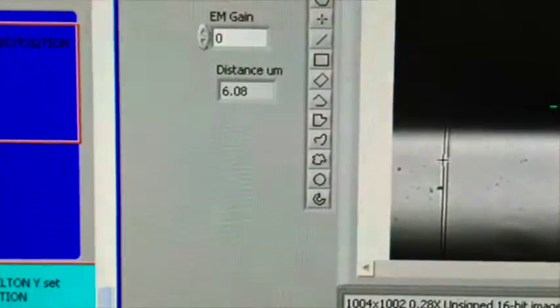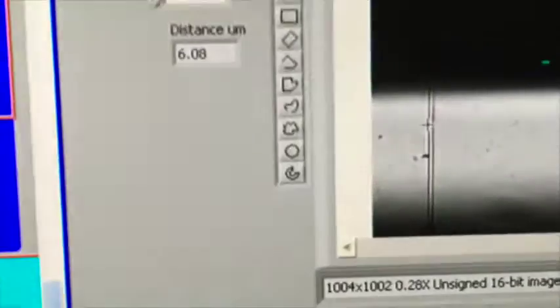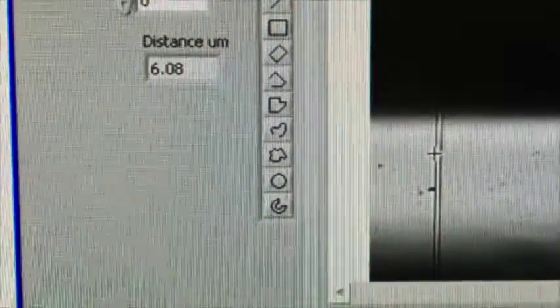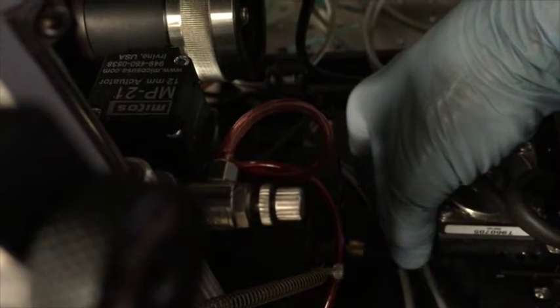And now I care very much about what the diameter of this tip is. And this little green dot is going to measure it. So there's two ways I can do that. I can bring the tip over to the dot, or the dot over the tip. I prefer to bring the tip over the dot. And to do that, there's a little knob right there that will move my tip over to the dot. And there it is, it's moved.